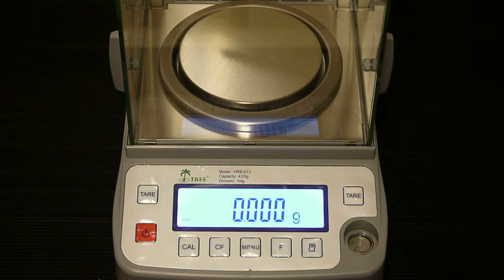In this video we are going to show you how to access and adjust the menu options on the HRB423 unit. Accessing the menu options allows you to change the weight unit settings and the parameter settings.